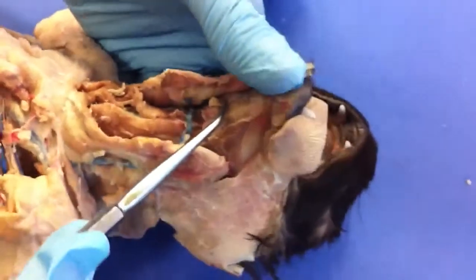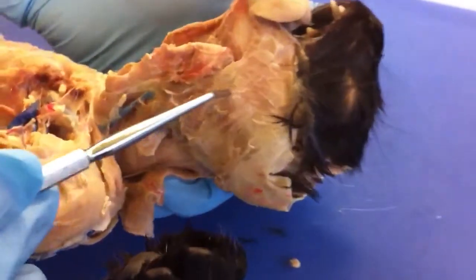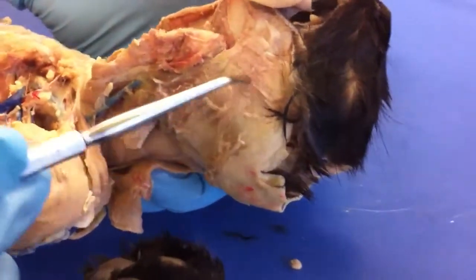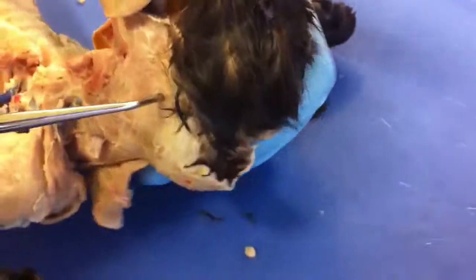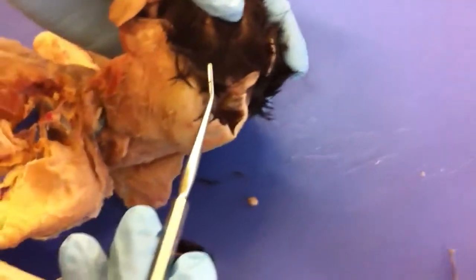On the cheeks, we have the masseter, which helps shut the jaw. And then also by the ears, we have the temporalis muscle, which also helps. So the cheek and top of the head — you'll know those are the masseter and the temporalis.